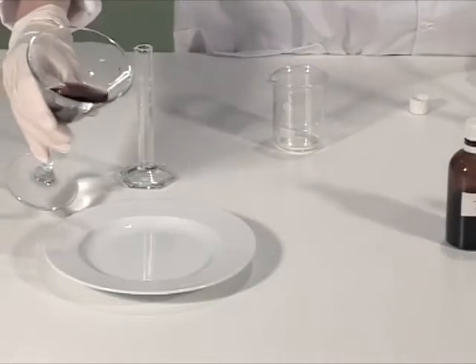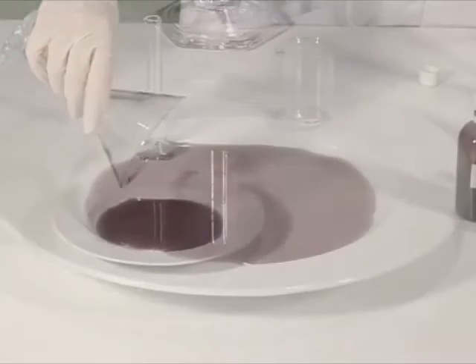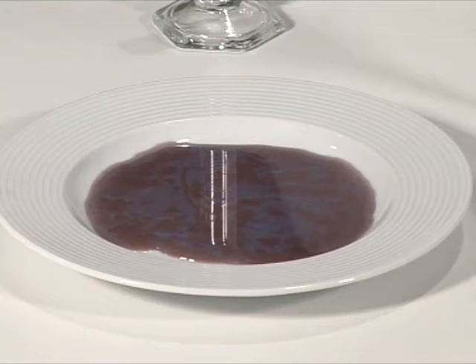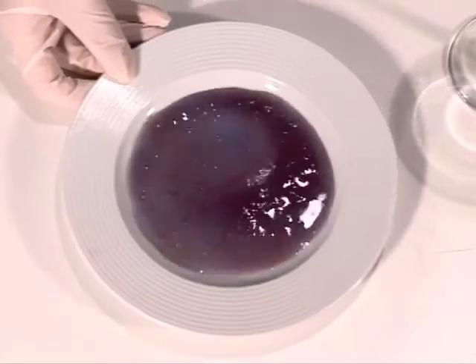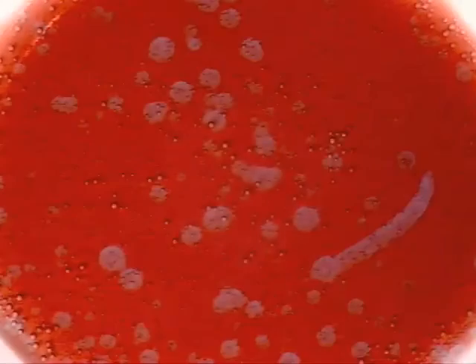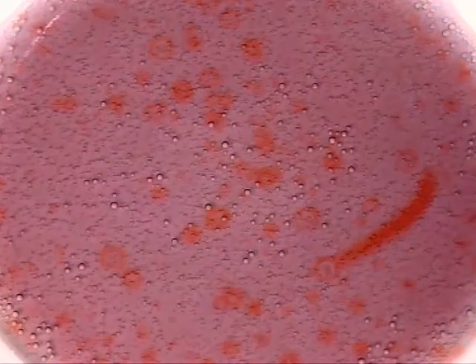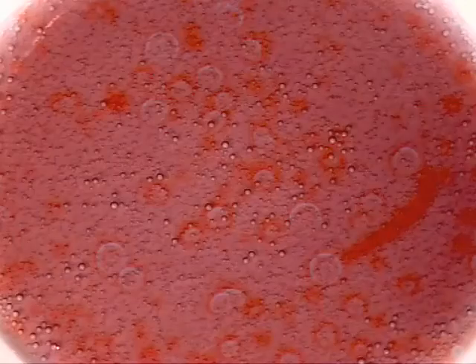It becomes much more fascinating if we pour the solution into a shallow plate. We can see the formation of concentric circles that then dissolve, while the colour rotation keeps on going. This reaction is a chemical seesaw between red and blue that stays longer on the red side.